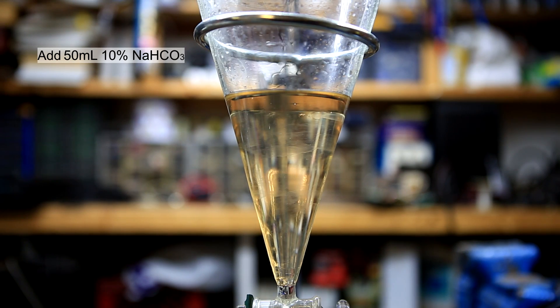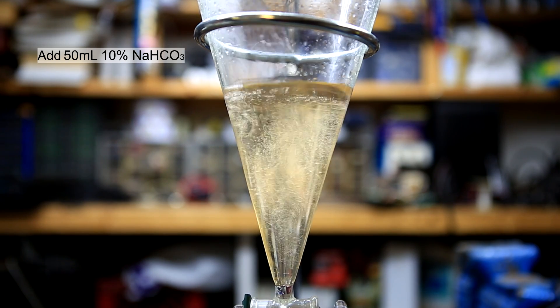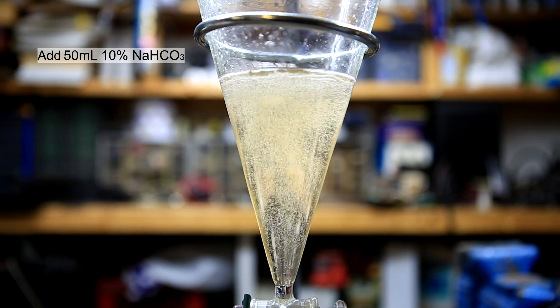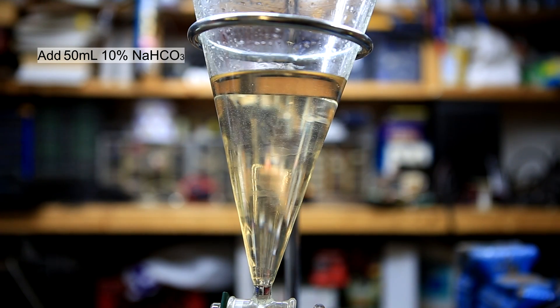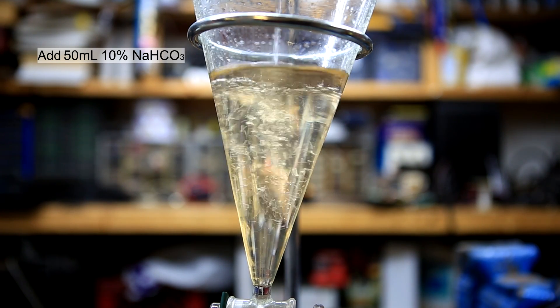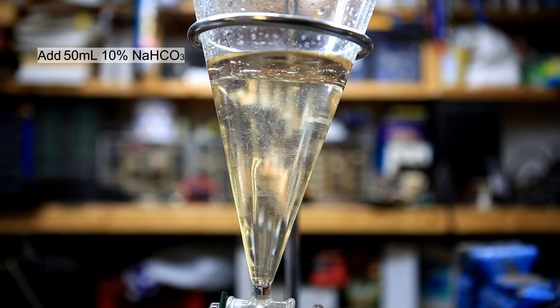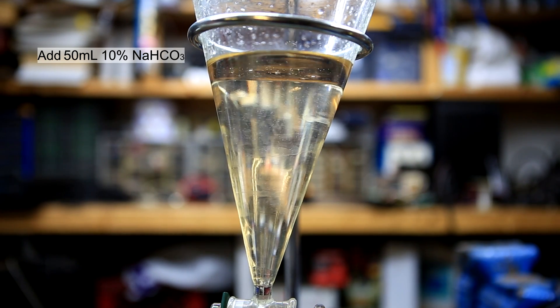This was done until it appeared that no more CO₂ was being produced. Then 50 more milliliters of sodium bicarbonate solution was added, capped, shaken, and vented. When a third 50 milliliter portion of sodium bicarbonate solution was added and not many bubbles formed, this indicated that the neutralization was complete.